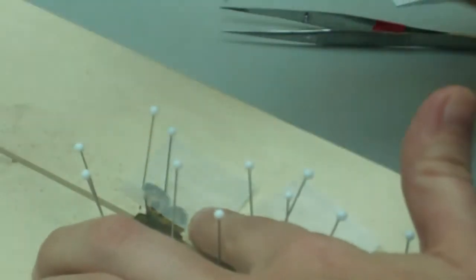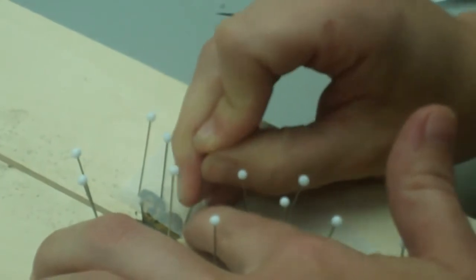Alright, that one looks pretty close to done, that's a good note, let's have a look. Looks pretty good to me with my expert eye.